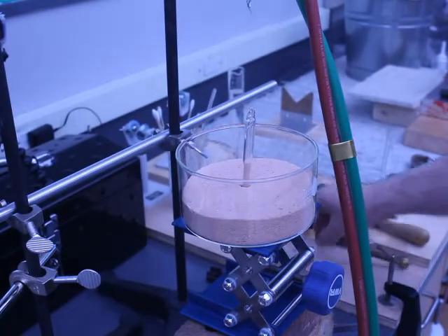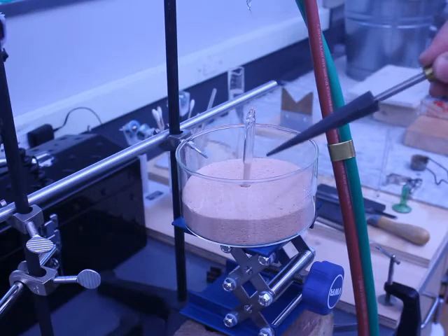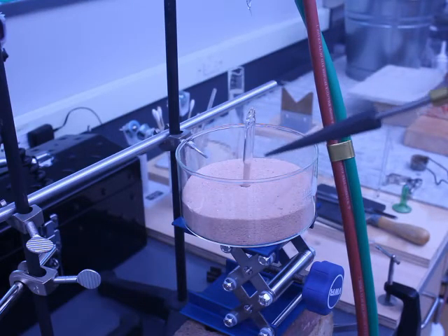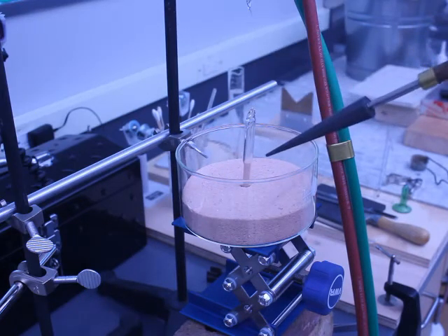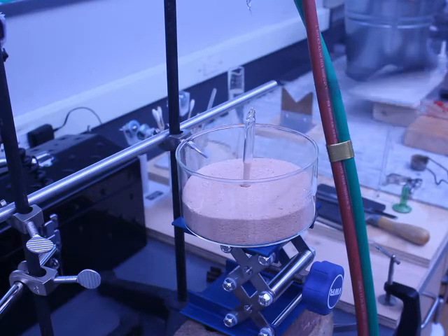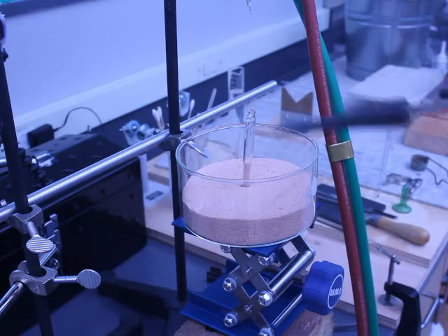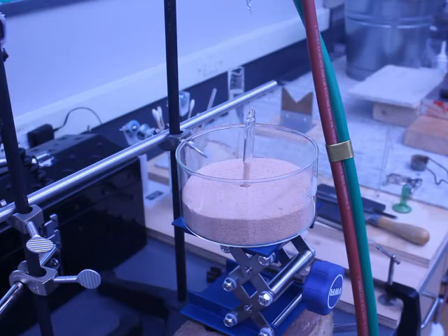My sample obviously is incredibly hot right here where I made the seal, but the sample itself is still at room temperature very close to it. Experimentally, many times if you're working with a solid or a liquid, instead of a sand bath, you would have it in a liquid nitrogen bath. And that would protect it from any heat. And if you're working with a liquid, well, if you pull a vacuum on a liquid, it's going to vaporize. So you would actually use liquid nitrogen to freeze it into a solid, flame seal it off. And then when it thaws out, it would be fine.